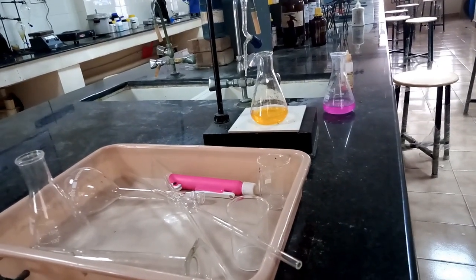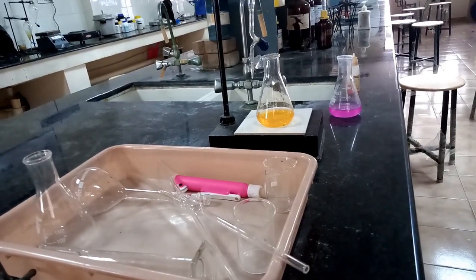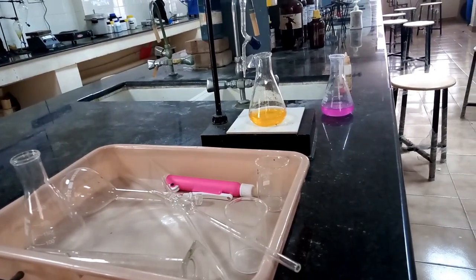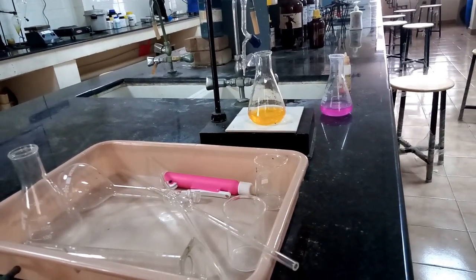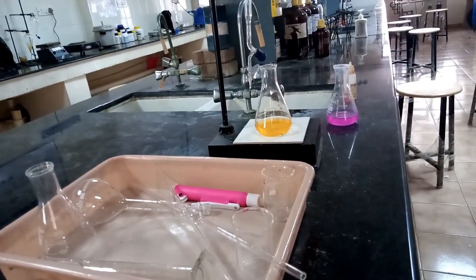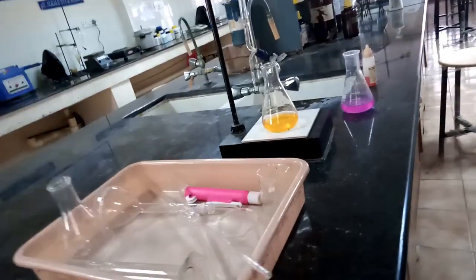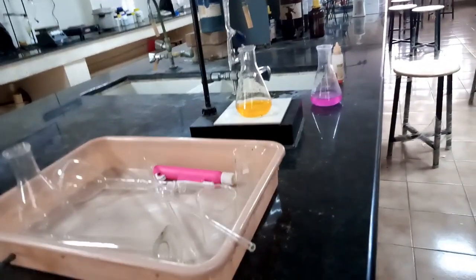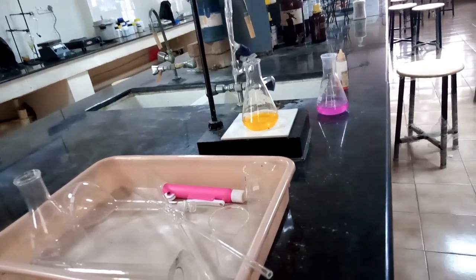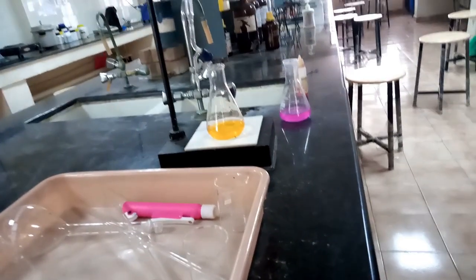In the titration, you are working against the opposite chemical reagent, so that it can utilize the required ions and give the value for either alkalinity or acidity. You take the sample in the conical flask, 20 ml or 50 ml as required in the manual.